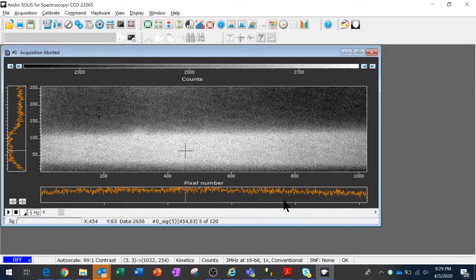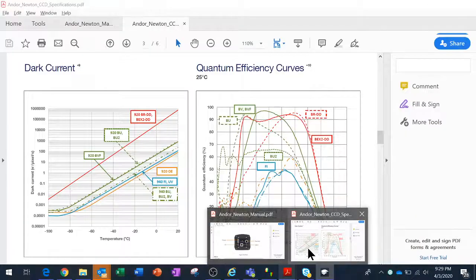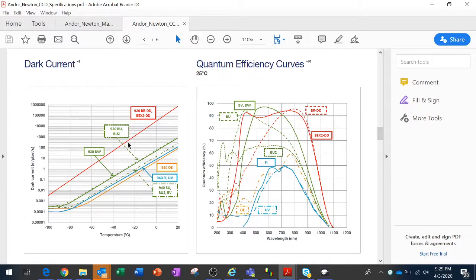So I can show you the effect of that cooling if I open up the spec sheet here for the BEX2 CCD. That's this variant in the red line. Every time I cool by 20 degrees, I lose about 1.5 orders of magnitude of dark current. So dark current here is in electrons per pixel per second, on a log scale, with temperature on a linear scale. You can see that the more that I cool, the quieter background I have. The first 20 degrees are the most important. We're going to lose something like 900,000 counts of dark current there. And then we squeeze more and more dark current out as we go deeper.